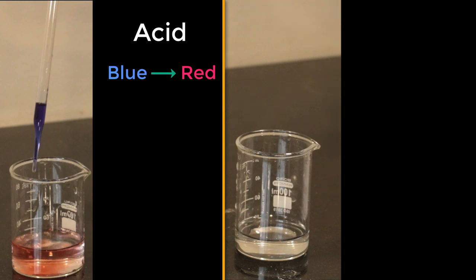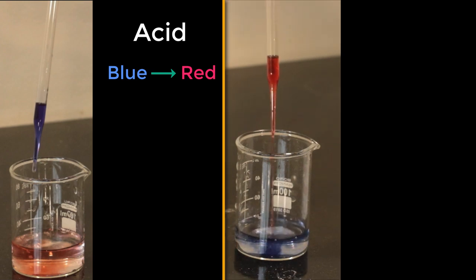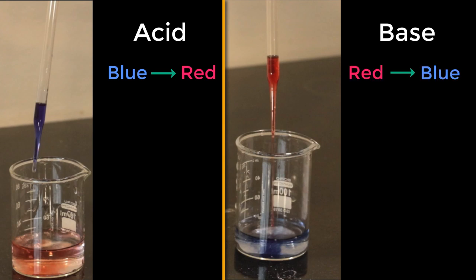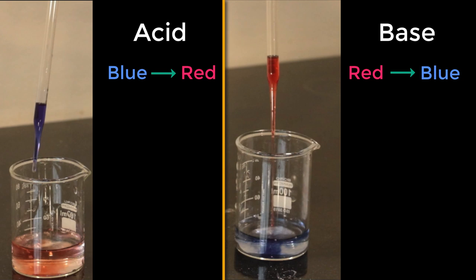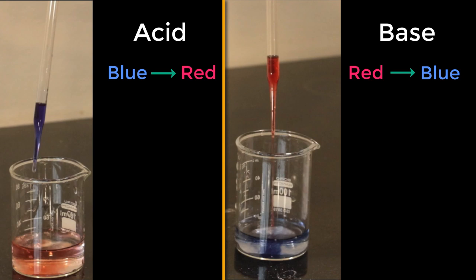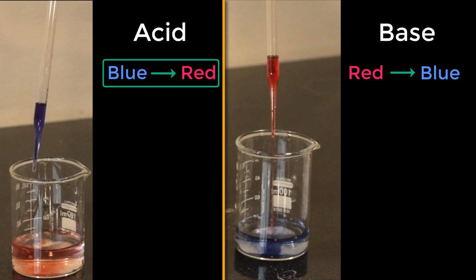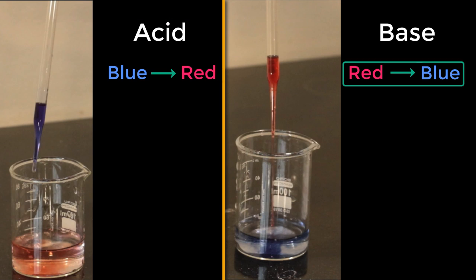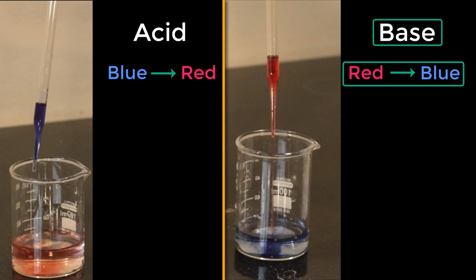Here I have a base and I'm going to add a red litmus solution to it. You can see that slowly the color is changing to blue. That means when a base comes in contact with red litmus, the color changes to blue — a base changes the color from red to blue. This is how litmus helps us identify a solution as an acid or a base. If you have an unknown solution and add blue litmus and it turns red, it's an acid. If you add red litmus and it turns blue, it's a base.